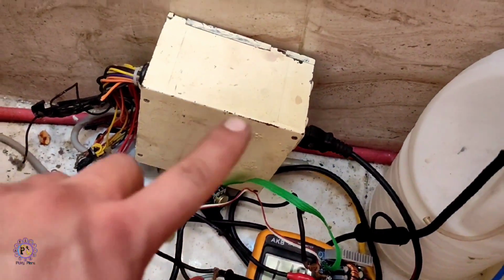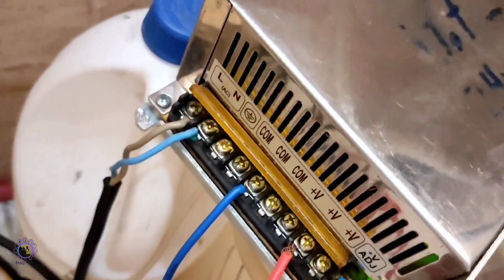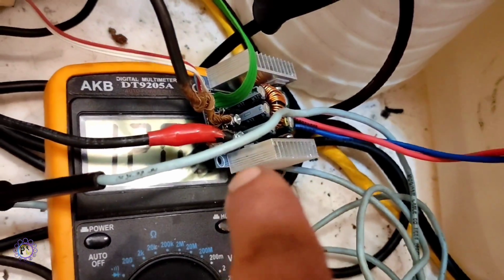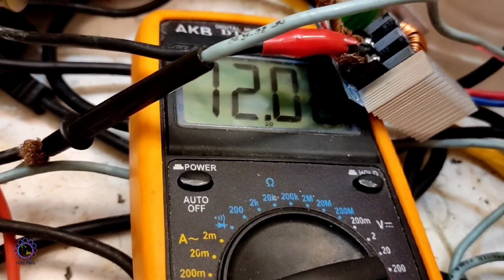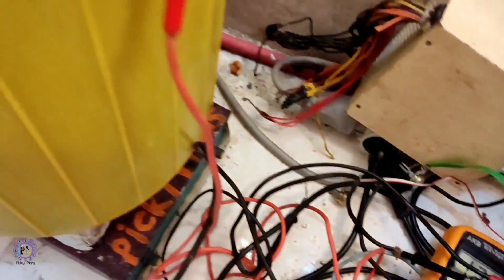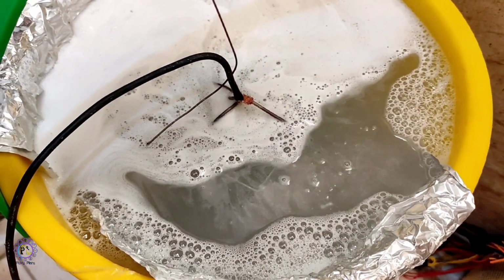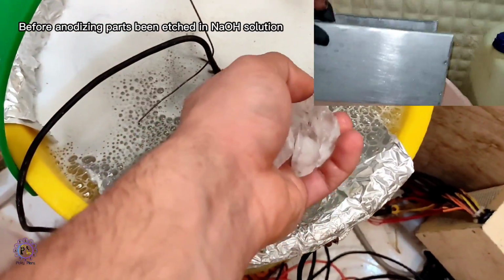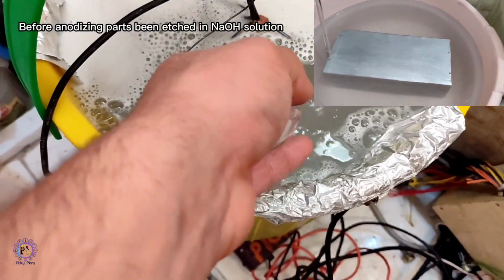Since the computer power supply wasn't powerful enough to anodize the whole surface area of the aluminum casing of the power supply, I used that buck converter and that setup that I want to use in my power supply to anodize the main casing. This time anodizing ran on 12 amps. I added some ice cubes from time to time to cool off the system temperature.